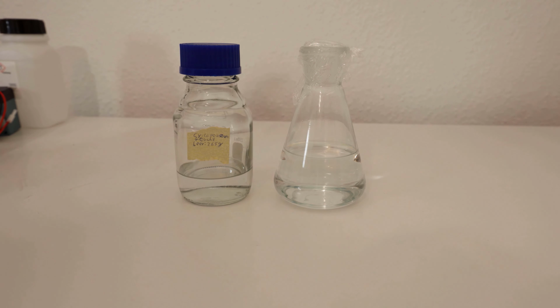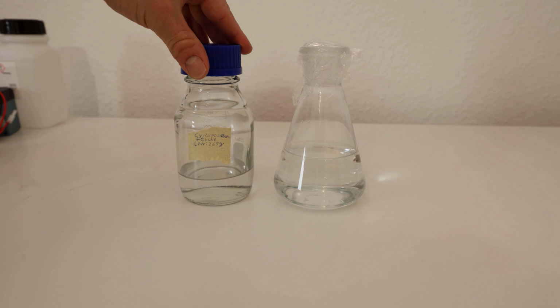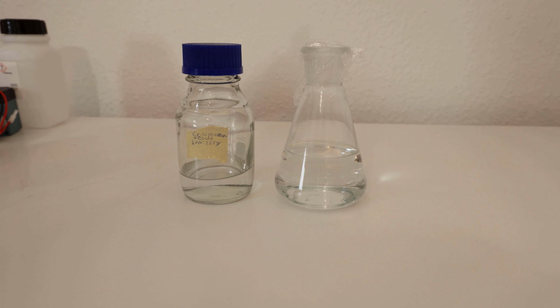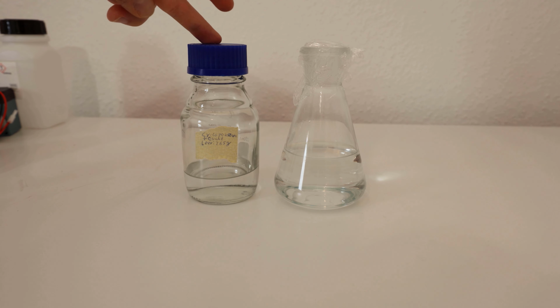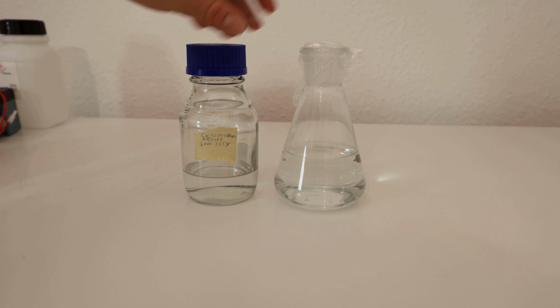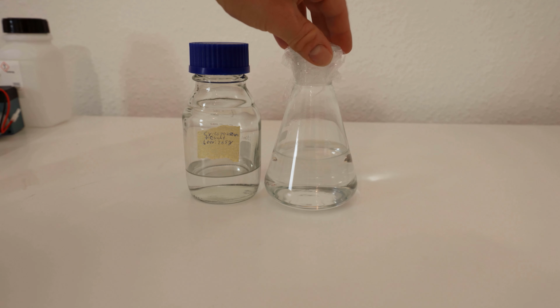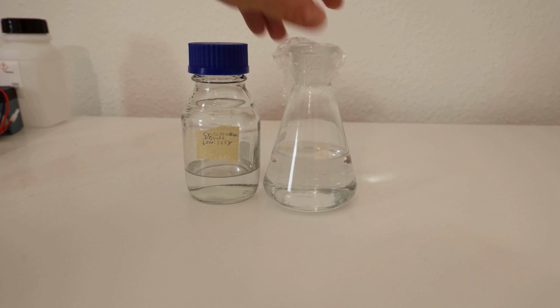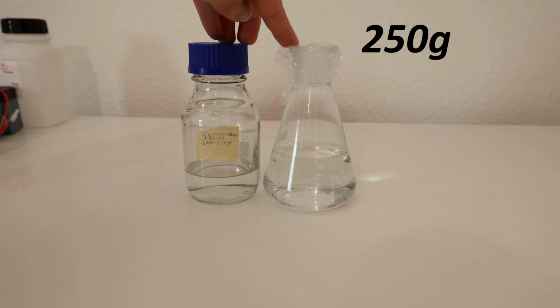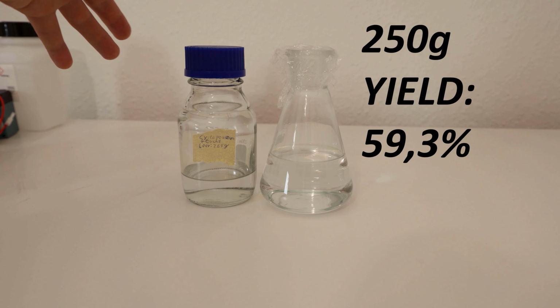And this is what I got from all of this distillation. This right here is some wet cyclopentanone, so I still have to dry it, or I could technically also use it as is. And this is 59 grams, and this is the bulk of the pretty dry cyclopentanone, and this is 191 grams. So in total I have 250 grams of cyclopentanone.